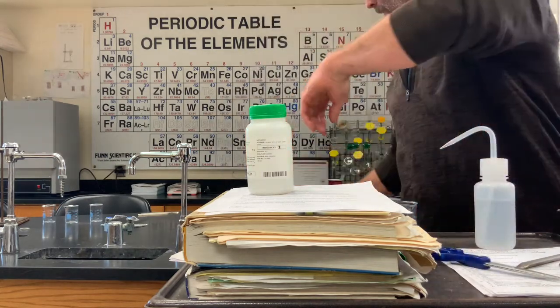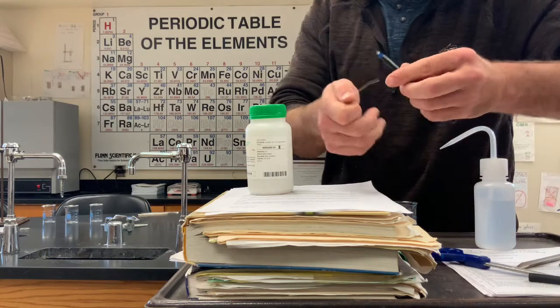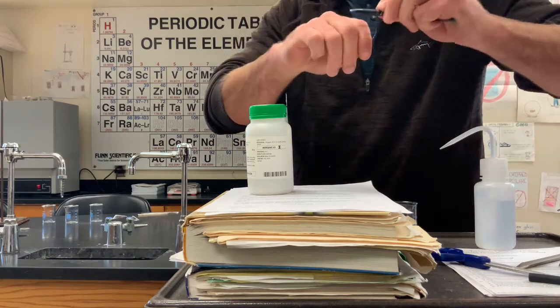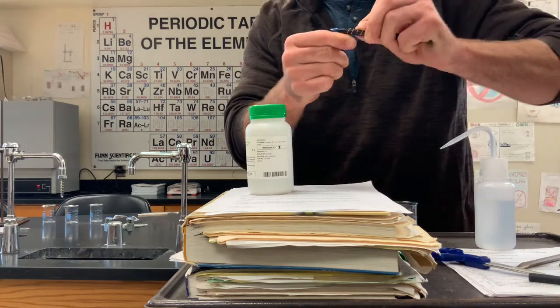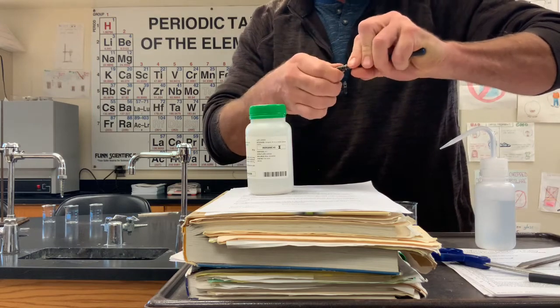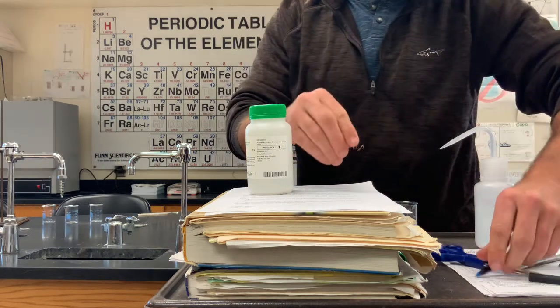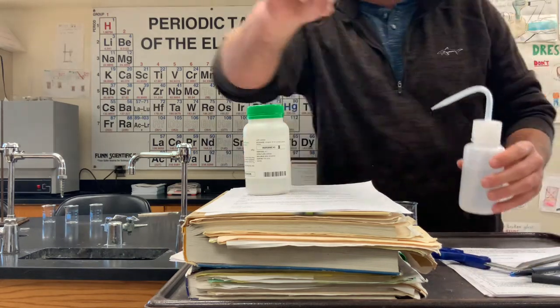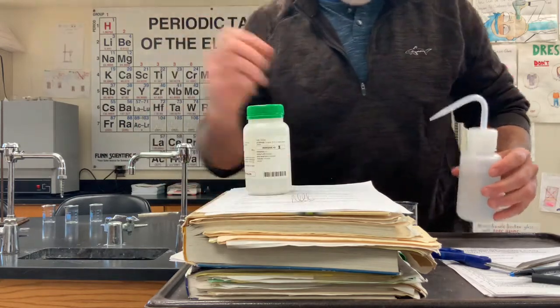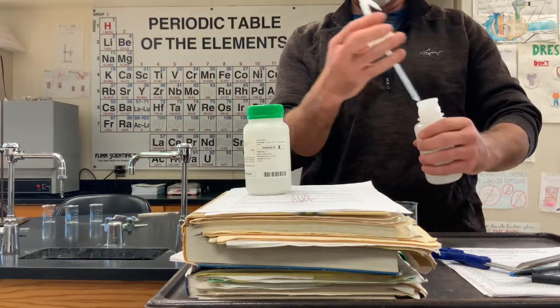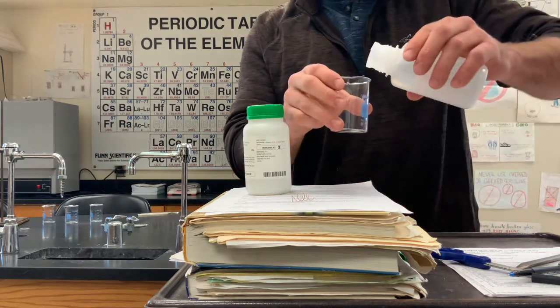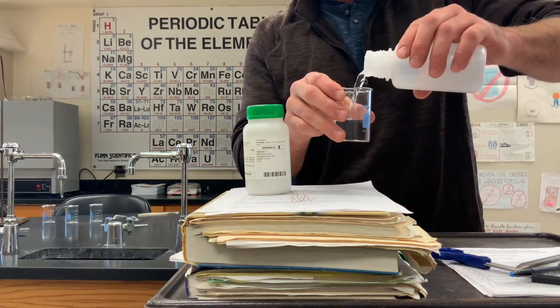I just need a little bit of copper. If I take my trusted blue pen, I can wrap it into a coil. Now, if you take this little copper coil and add it to some distilled water.